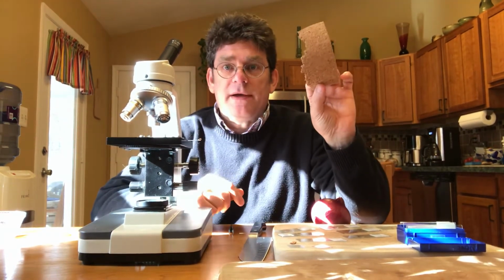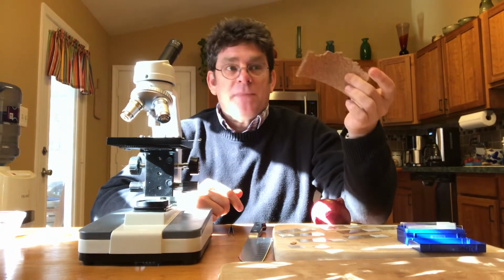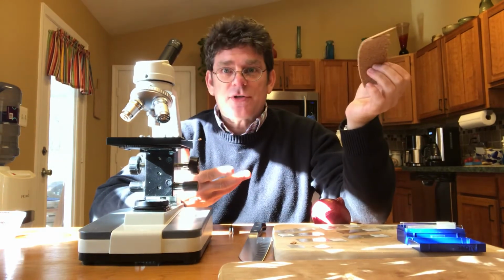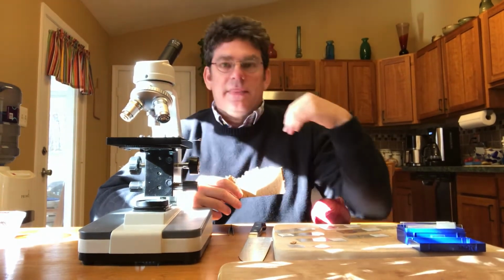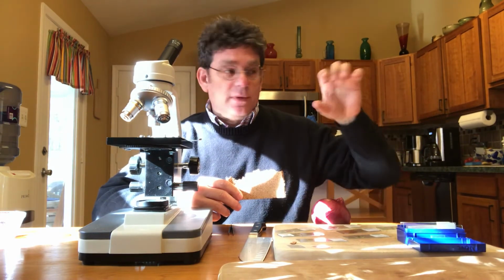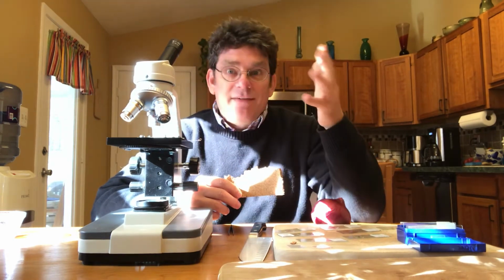Now again, why am I showing you cork? I'm showing you cork because a scientist named Robert Hooke, an English scientist back in the 1600s, wanted something interesting to show some of his scientist friends. And so he had an early microscope, and he looked at some cork, and he thought that they looked like little rooms. And the word cell in Latin means little rooms. They reminded him of, today we think jail, prison cells. They reminded him of monk cells, so little rooms where monks would stay to pray. They kind of looked like that to him, so he gave them the name cells.